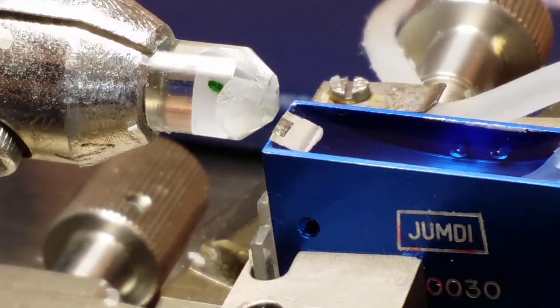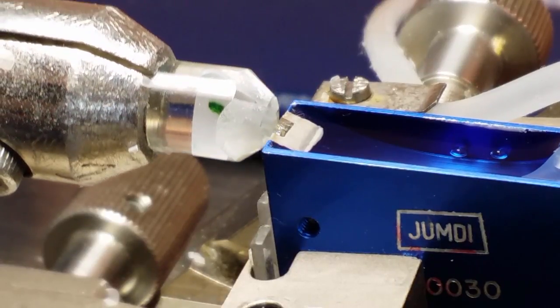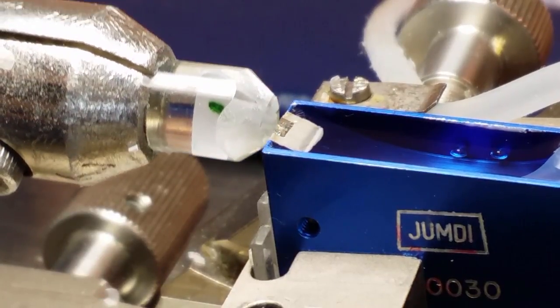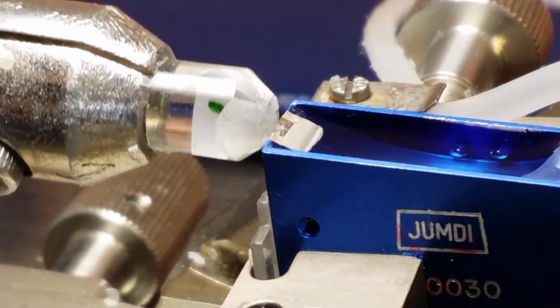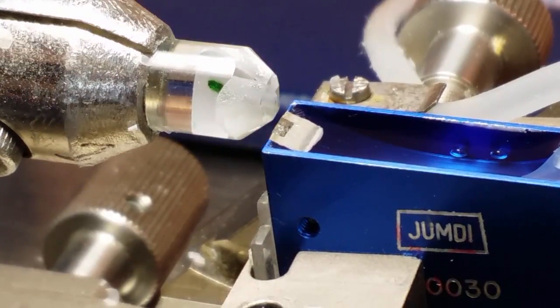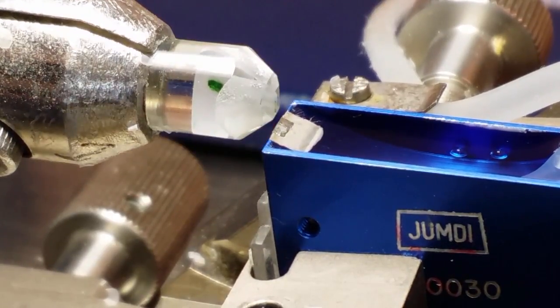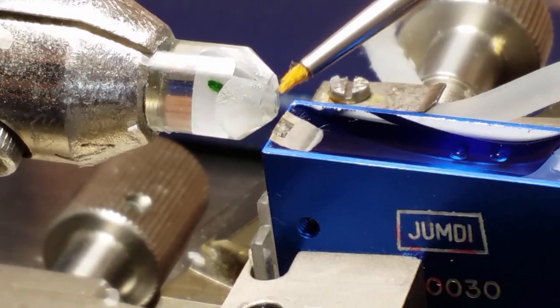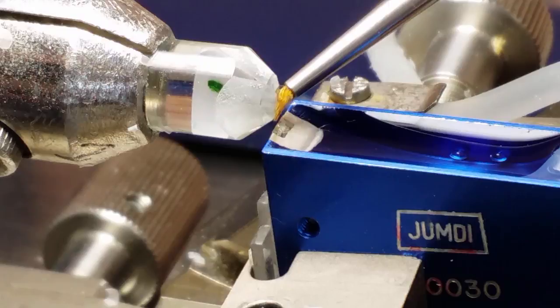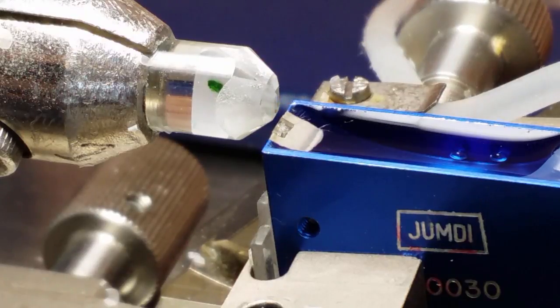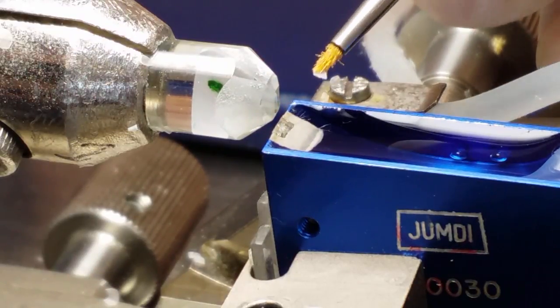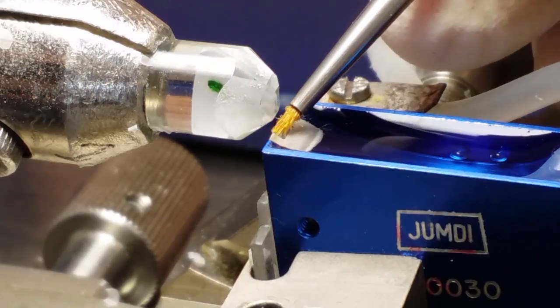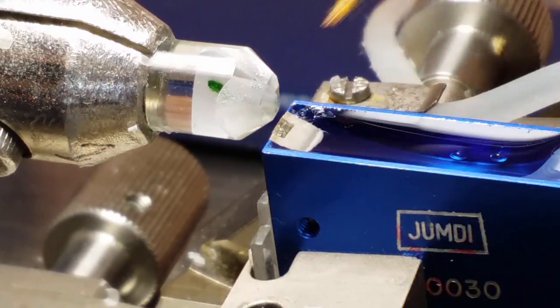When the slices are colorful, that means that they are in the visible light range of thickness. And that means sort of a micrometer size. Then they become thinnest suitable for electron microscopy. Then they become more transparent and less colorful. Now I got water on top of my sample. We don't want that. So I clean it with a brush. You can also use the brush to gently clean off the pieces on the knife.